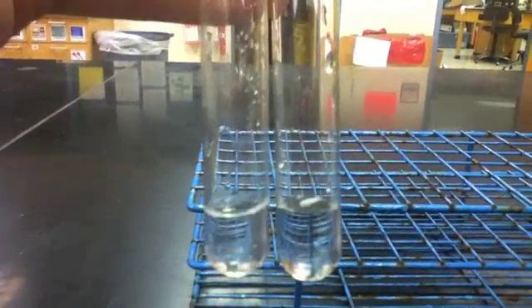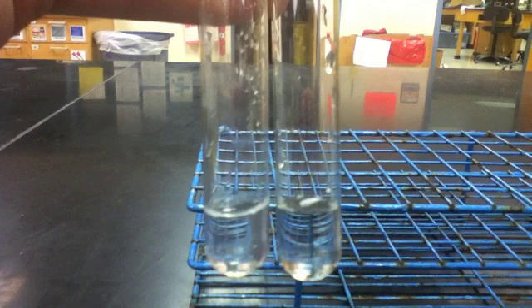The starch solution will act as our positive control, while the water solution acts as our negative control.